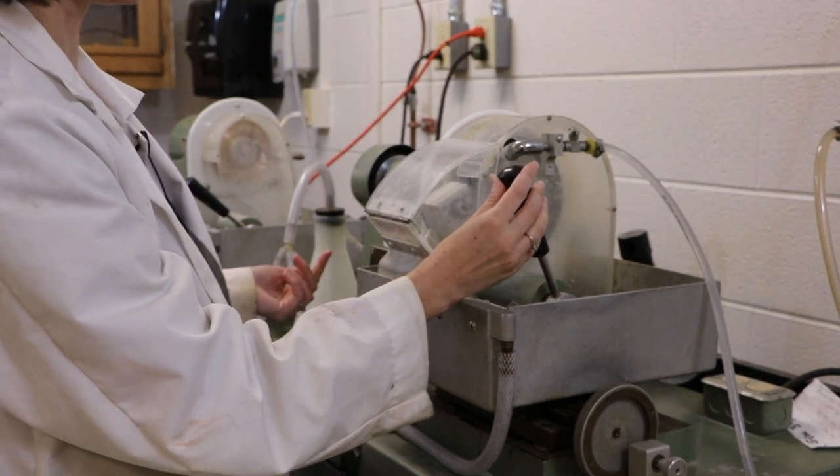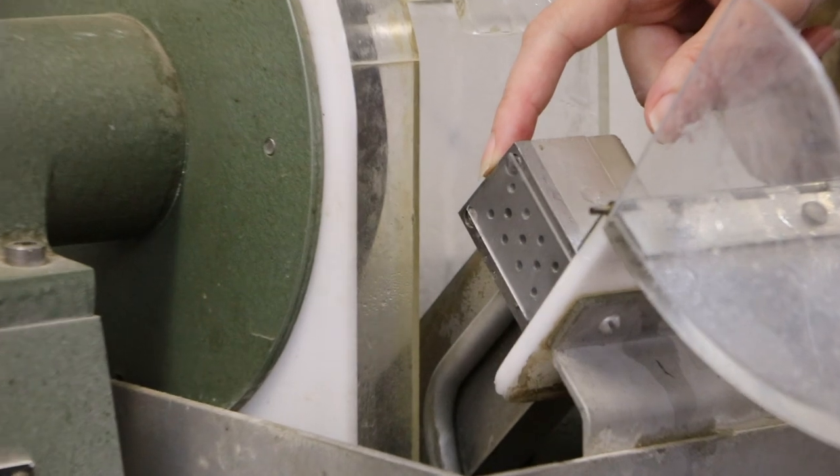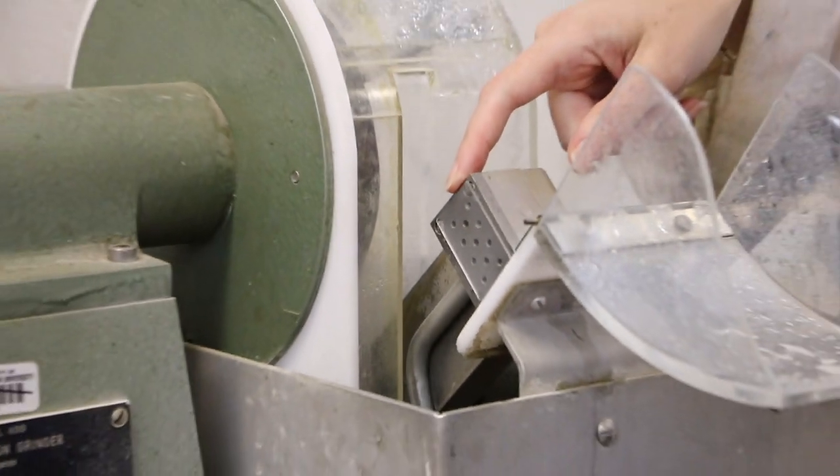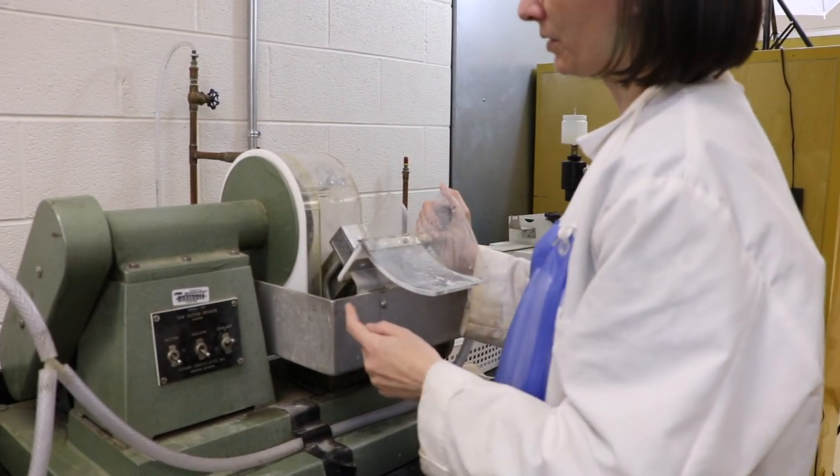One good tip is to not go too fast, because if you go too fast you tend to shatter the glass. To detach the slide from here, I have to turn the pump off because the pump is keeping it on there with a vacuum.